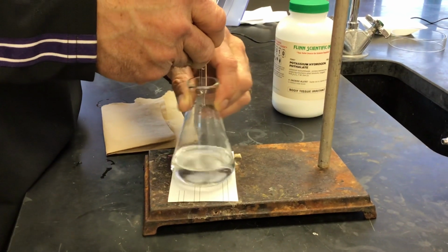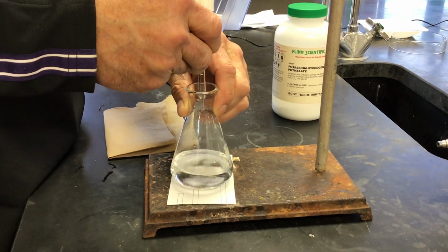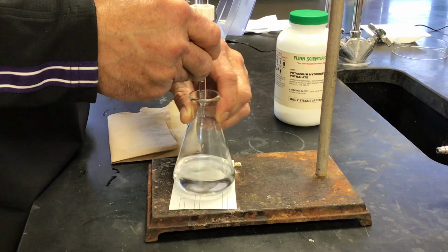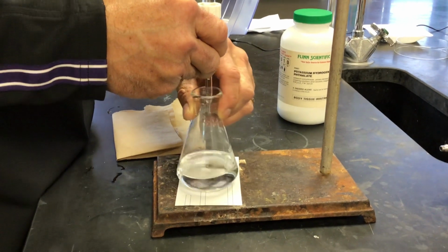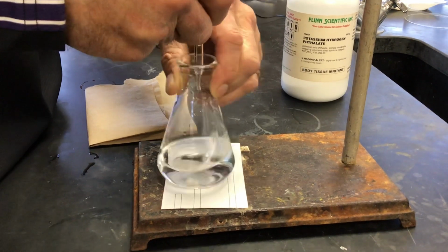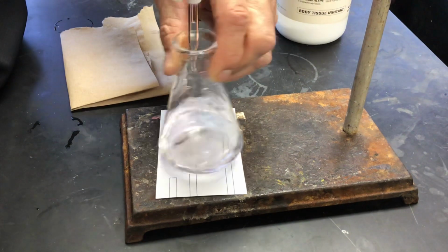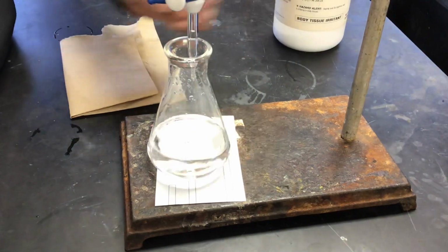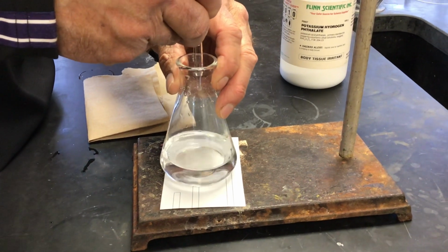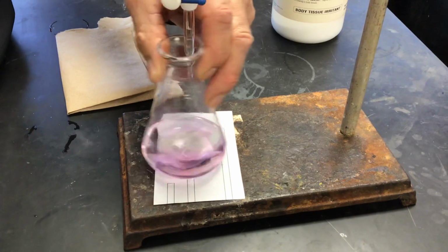Mr. Hevel is a professional. He can do it all himself. I think we're pretty close. Come on, one more drop. He wants to be more close. That's it.